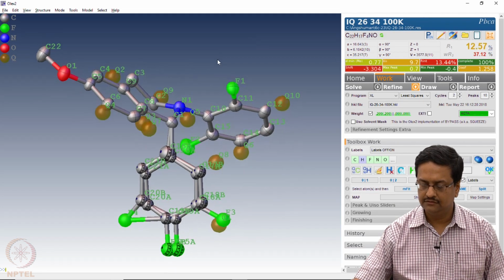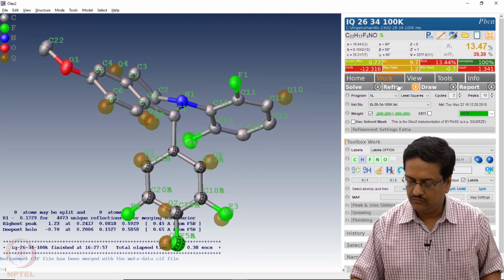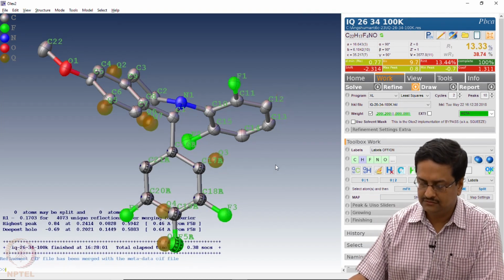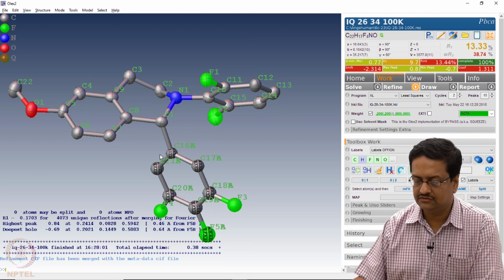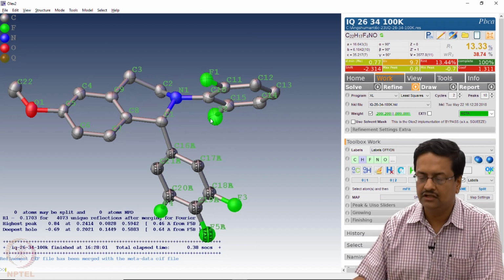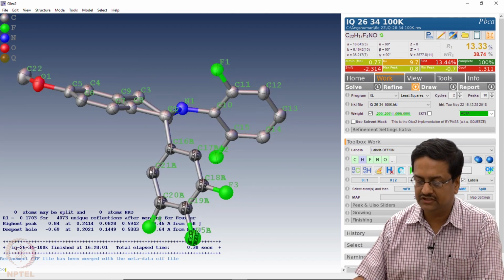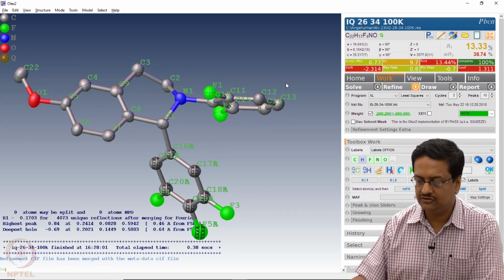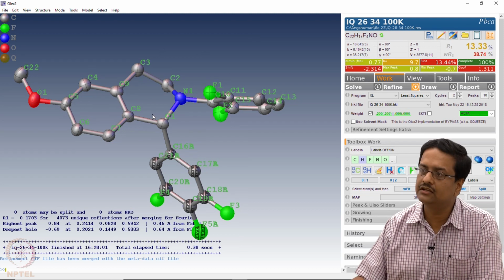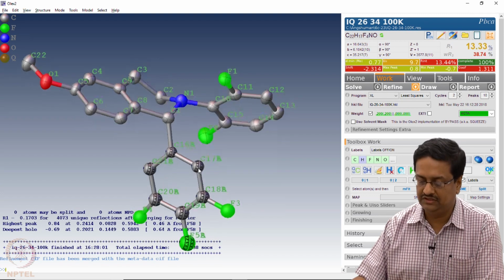And then refine it a couple of times. What we see now is that the atoms which are having EADP and EXYZ commands are having those symbols embedded in those atoms, and the atoms which are refined generally, they are not having any information of EADP or EXYZ. And at the moment these are all in anisotropic format, the top part of the molecule, and the bottom part of the molecule has only isotropic thermal parameters.